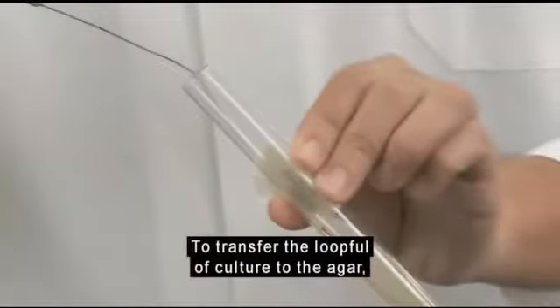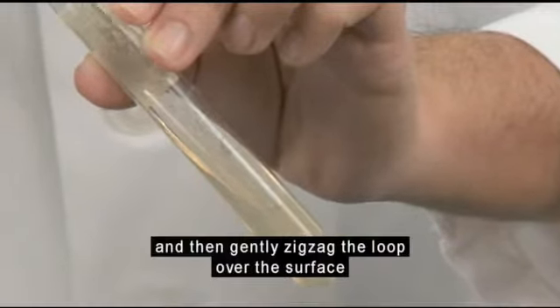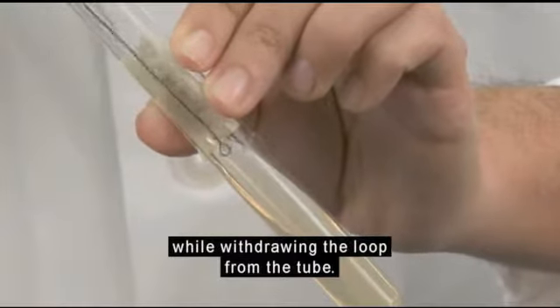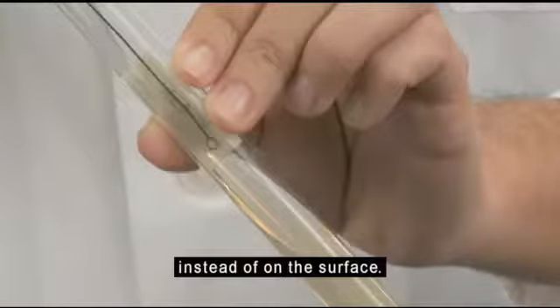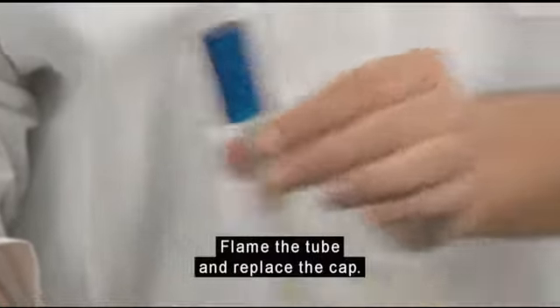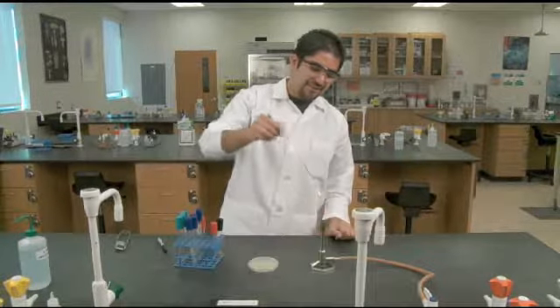To transfer the loop full of culture to the agar, hold the loop parallel to the agar surface. Touch the agar and then gently zigzag the loop over the surface while withdrawing the loop from the tube. Do not dig into the agar, or you will deposit most of the bacteria inside the agar instead of on the surface. Flame the tube and replace the cap. After returning the tube to your test tube rack, flame the loop to destroy any remaining bacteria.